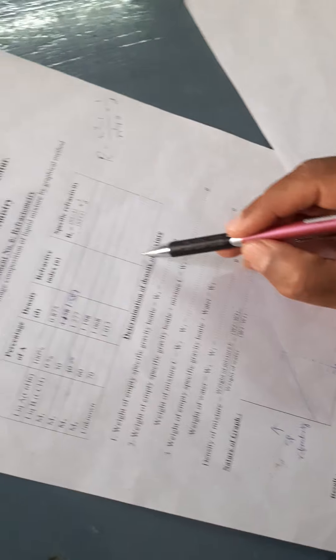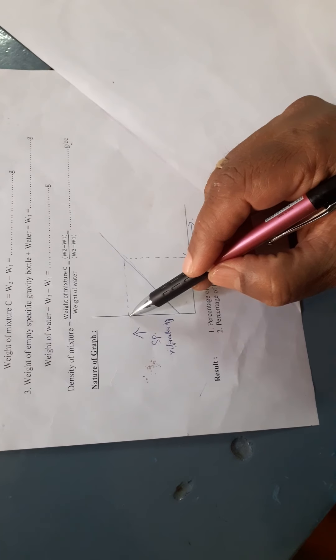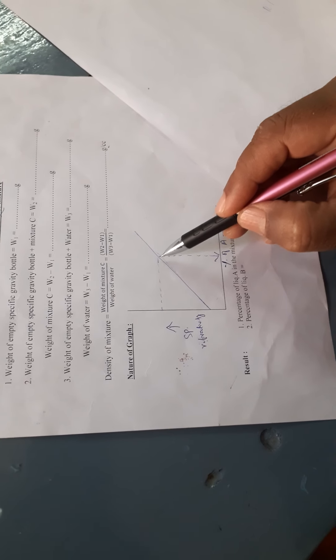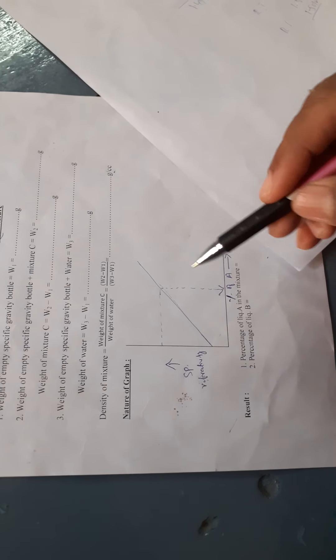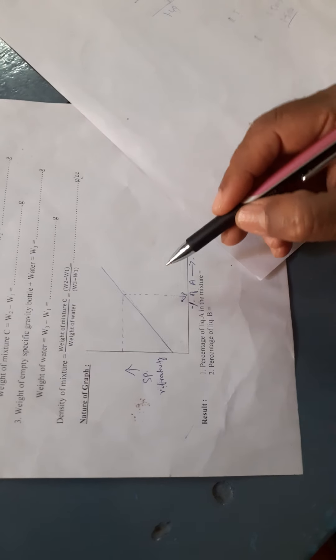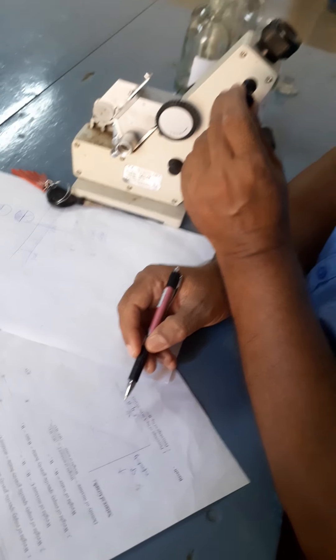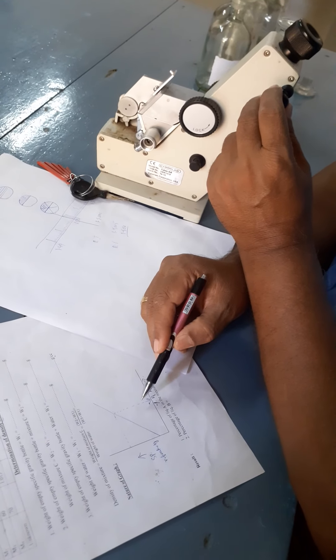By knowing the specific refractivity of the unknown liquid mixture C, mark that value on the Y-axis. From that point, draw a horizontal line to the straight line on the graph, then draw a perpendicular to the X-axis. The point where it cuts the X-axis gives the percentage of A in liquid mixture C. This is how we determine the percentage composition of the unknown liquid mixture using the refractometer with the help of a graph — the graphical method. Thank you.